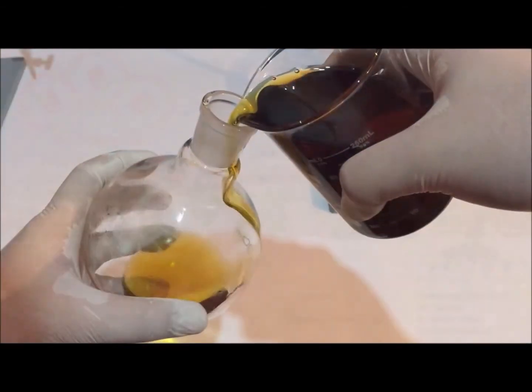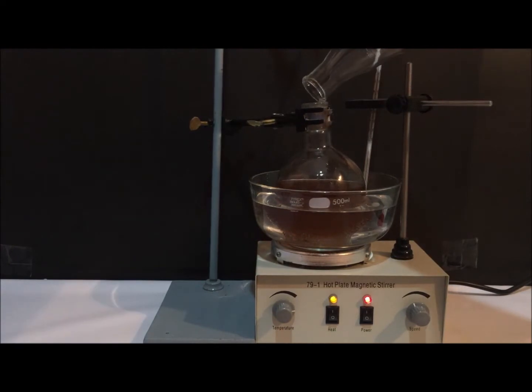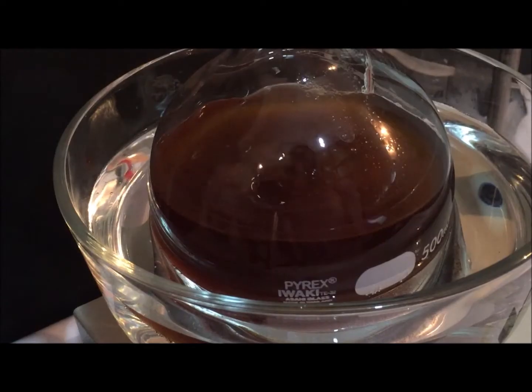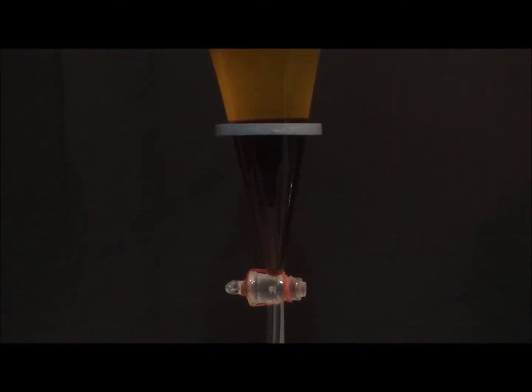Hello everyone. I am Muhammad Bilal Khan, a research student at School of Mechanical and Manufacturing Engineering, National University of Sciences and Technology, Islamabad. In this video, I'll be demonstrating the steps involved in biodiesel production.